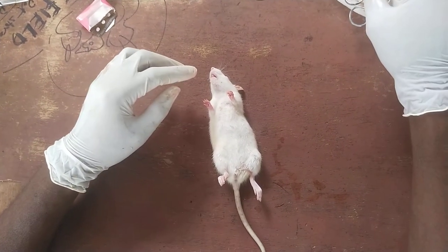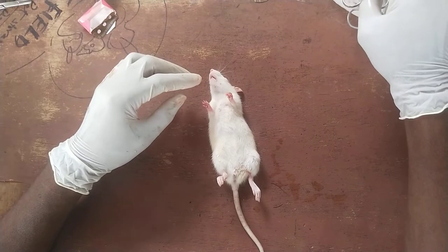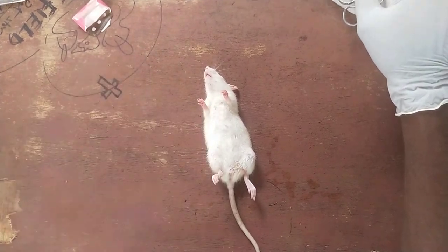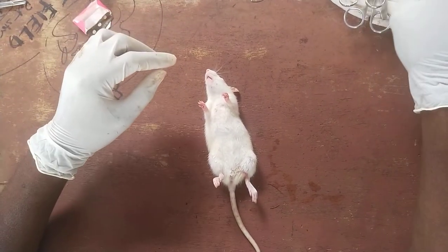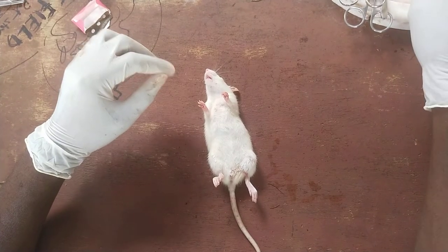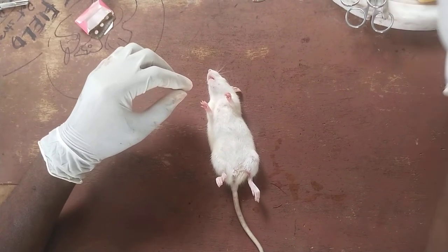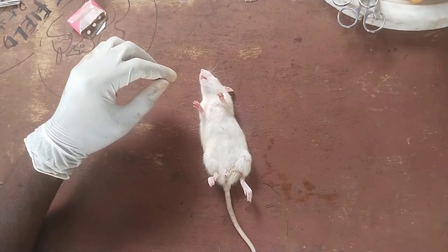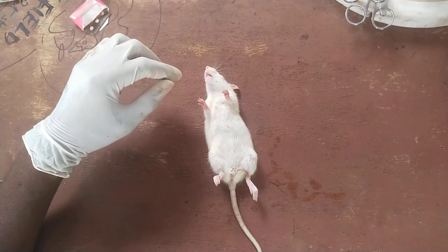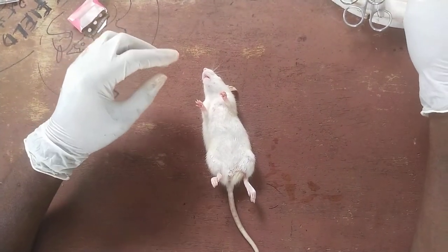What we want to do is remove the ovaries of this animal, and that procedure is called the ovariectomy — the removal of the ovary. So the first thing we need to do is of course administer anesthesia.